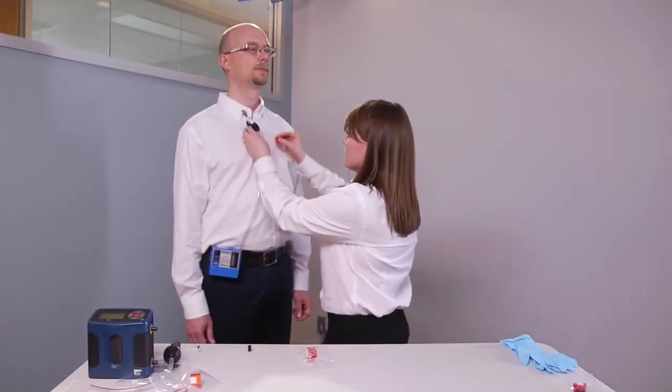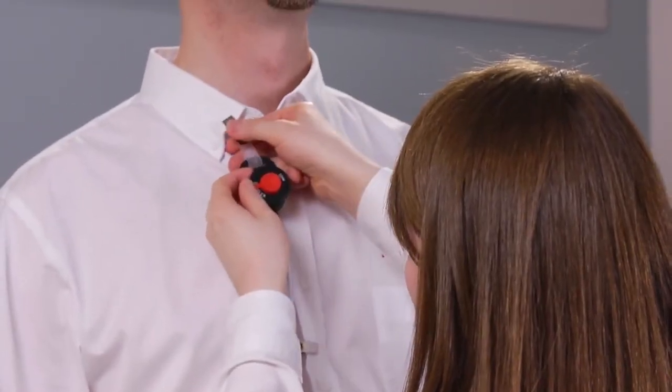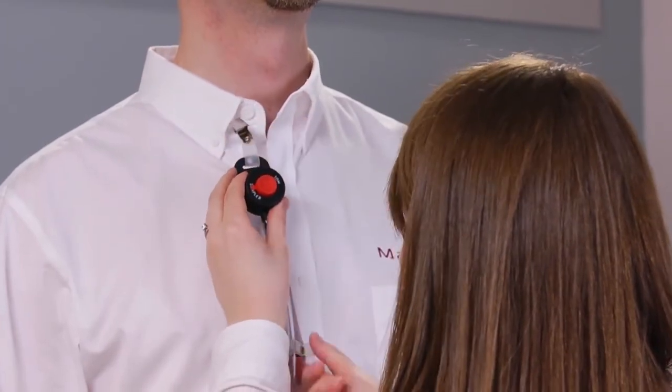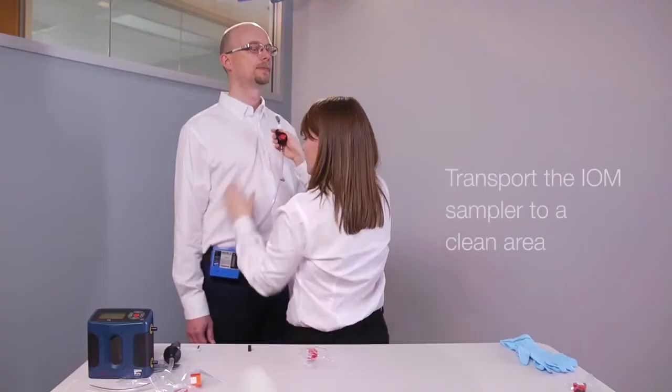Immediately cap the IOM sampler. Remove the pump and sampler from the individual and transport it to a clean area.